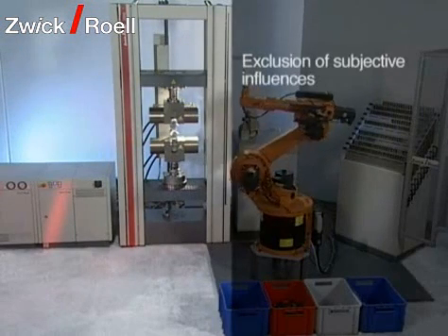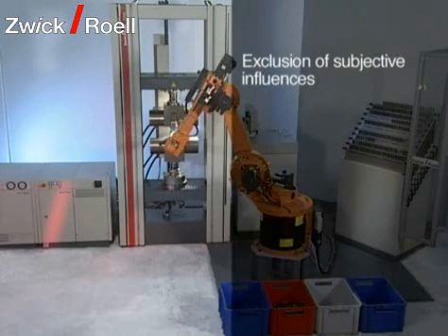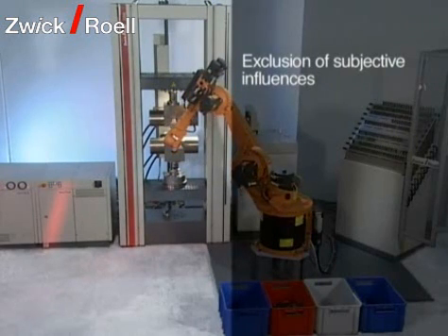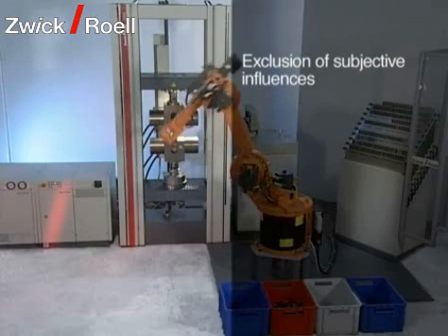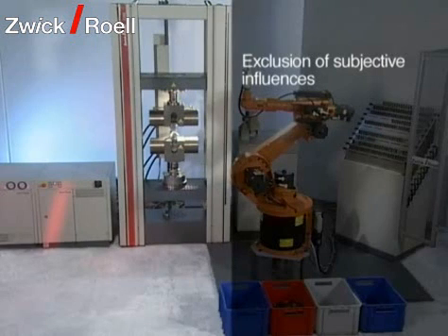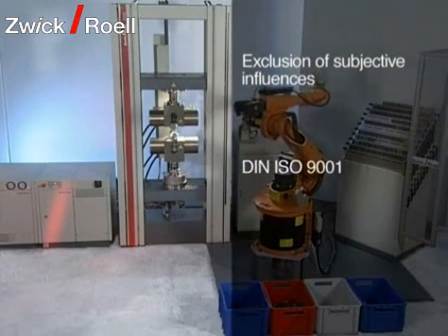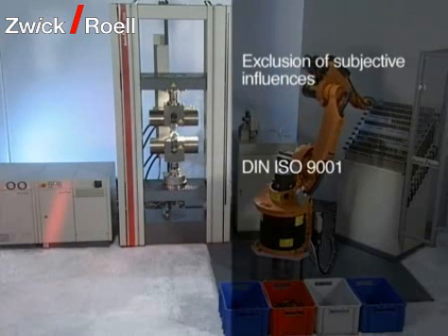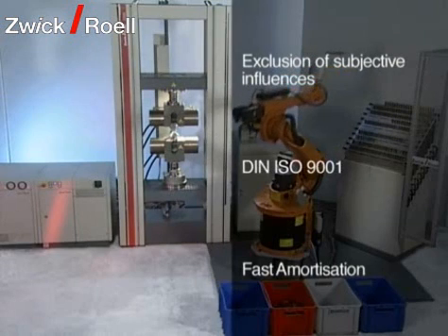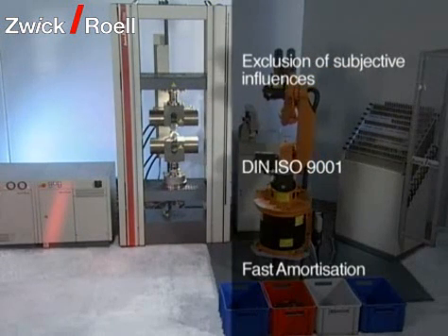Subjective influences are excluded by the high positioning accuracy of the automatic test system. When carrying out manual tests, these may, through different users, negatively influence the quality of the test results. The reproducibility of the testing requirements according to DIN ISO 9001 is guaranteed. Because of the low test costs per specimen, the test system with automatic specimen feeding will pay off within approximately two years.